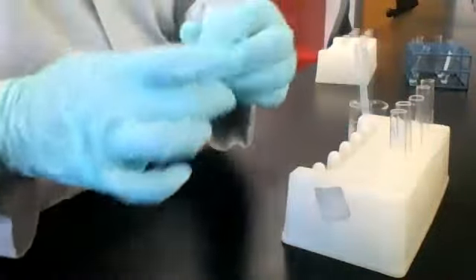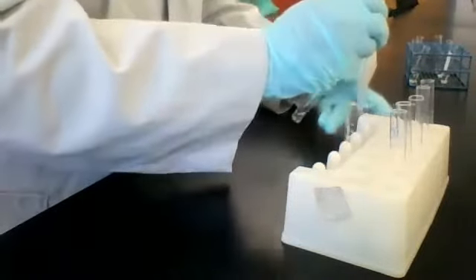All right, let's try our unknown A, and I'm about to add some HCl to it. See what happens.